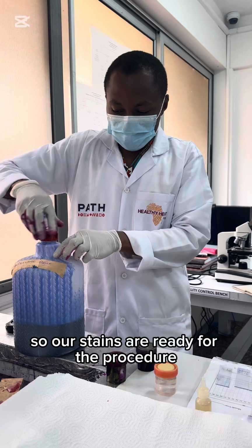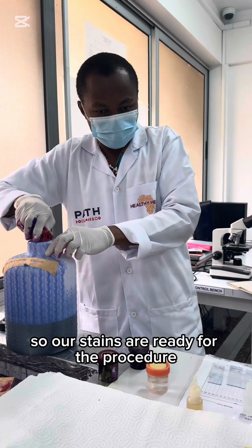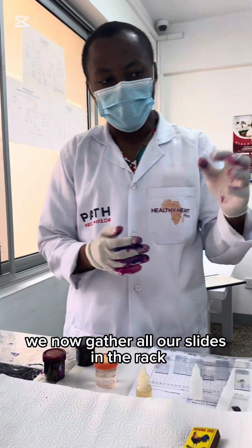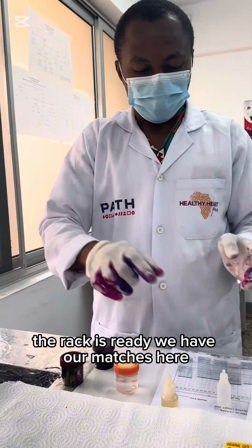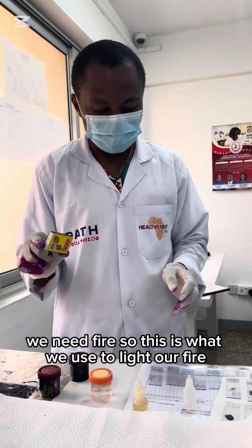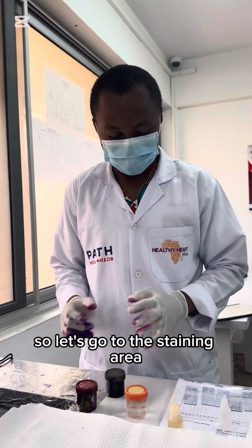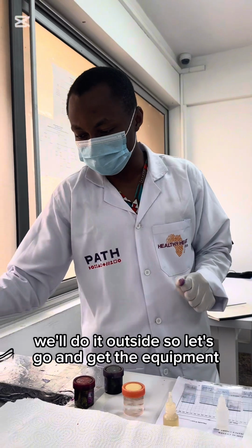So our stains are ready for the procedure. We now gather all our slides in a rack. The rack is ready. We have our matches here. So in the staining process we need fire. So this is what we use to light our fire. So let's go to the staining area. We'll do it outside.